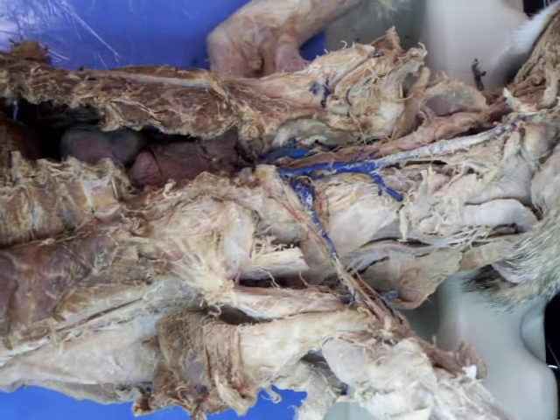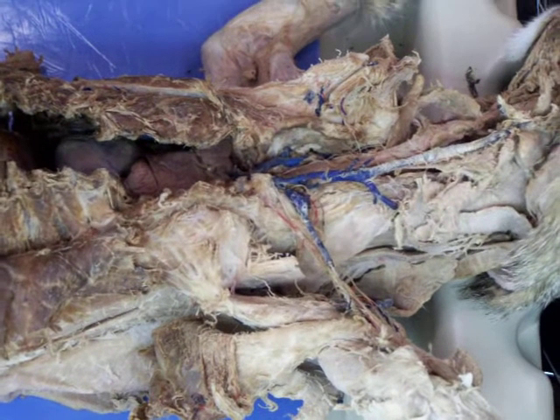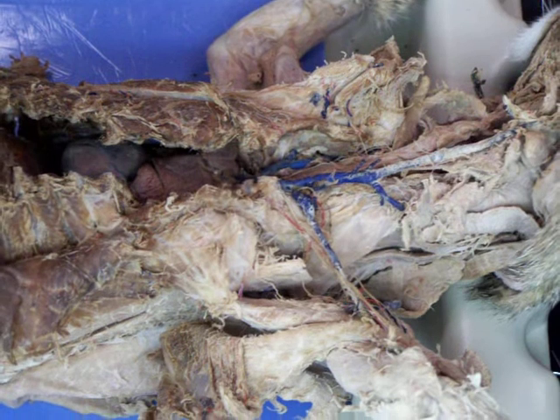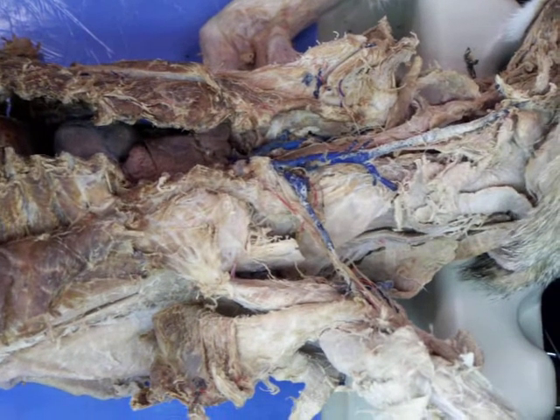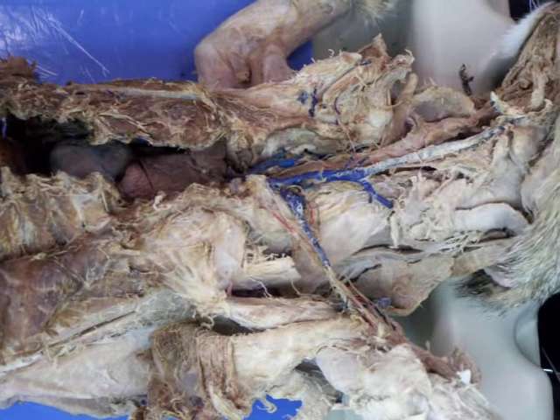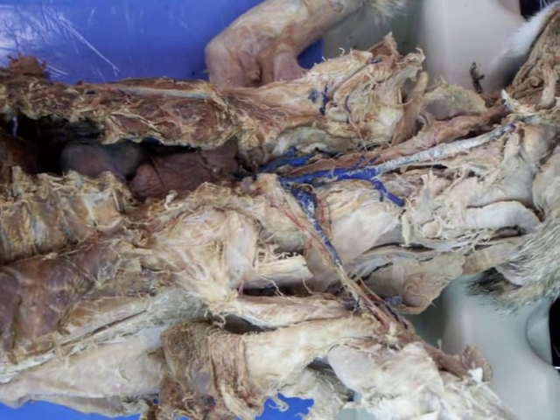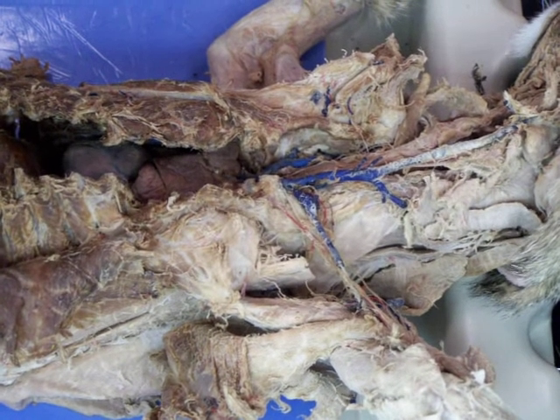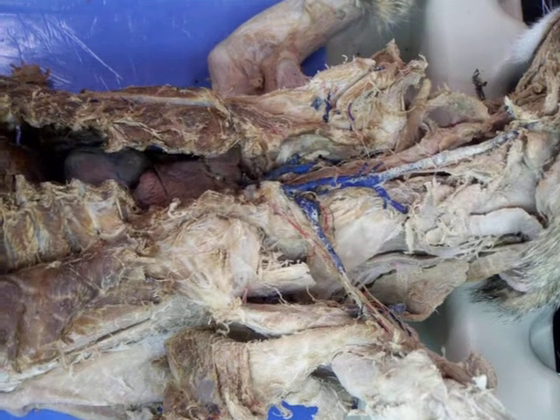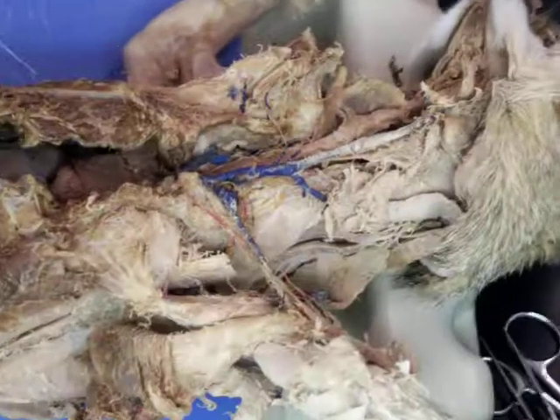Okay. What comes off of it? Common carotid. Cranial thyroid artery. Okay. And internal and external carotid. And internal carotid ligament. Let's not worry about that yet. What are the others? You probably will not see the internal carotid ligament. Okay. Especially in something like this, there's also the ascending pharyngeal artery. Okay. What else right in there?